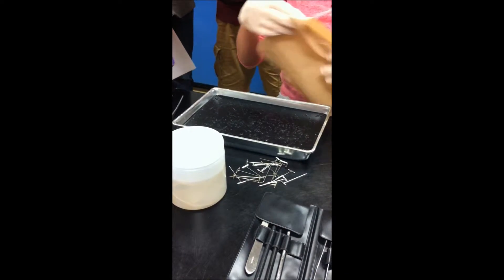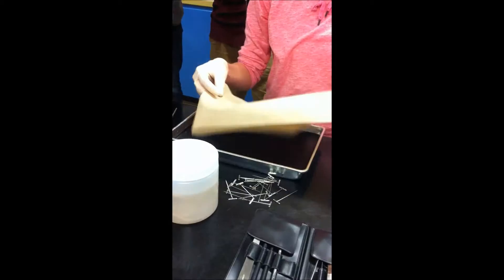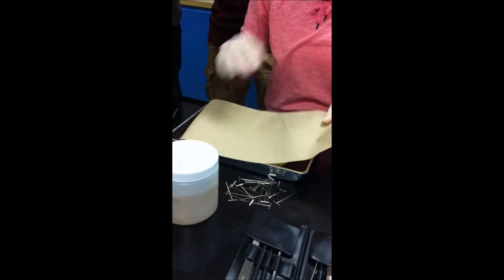Okay, so first thing we're going to do, we're going to cover and protect our trays. We're laying a paper towel down first.